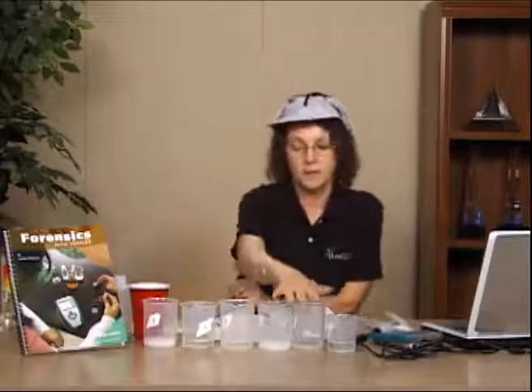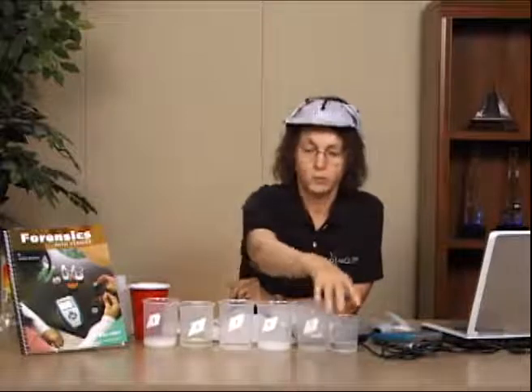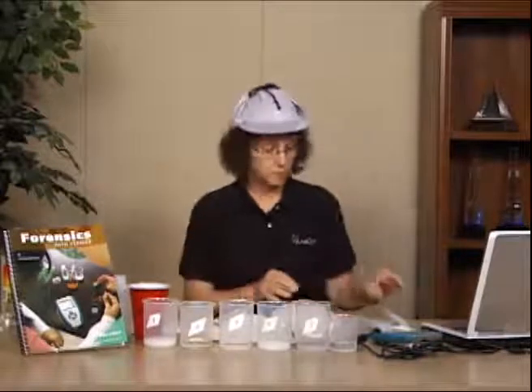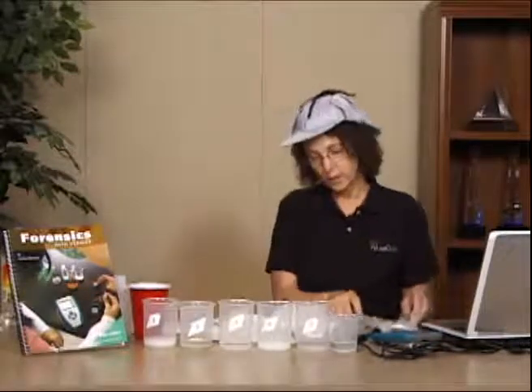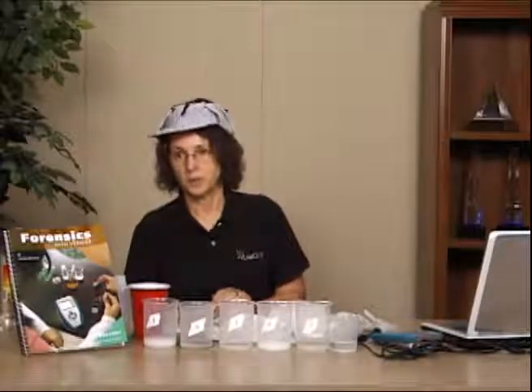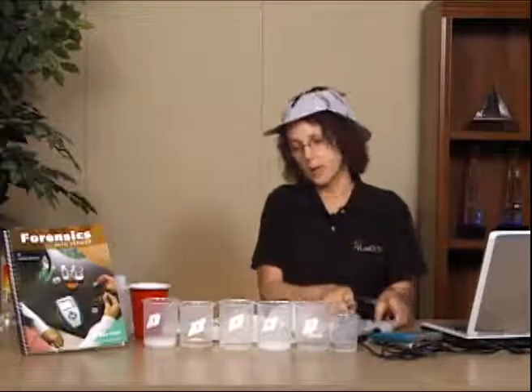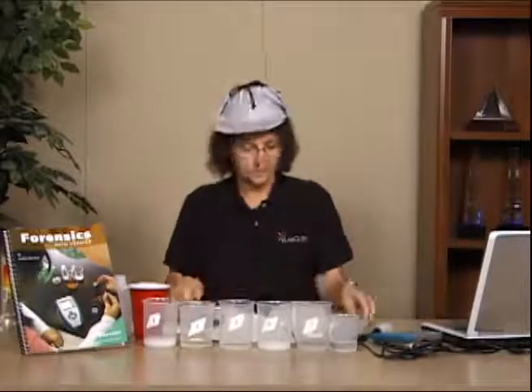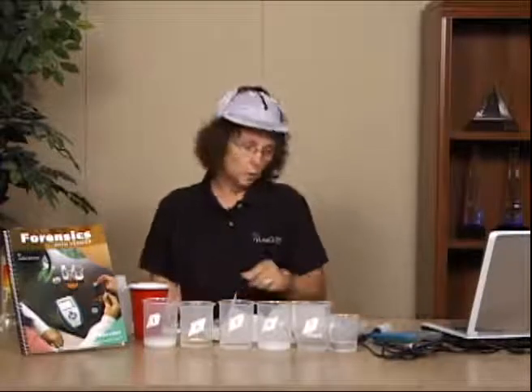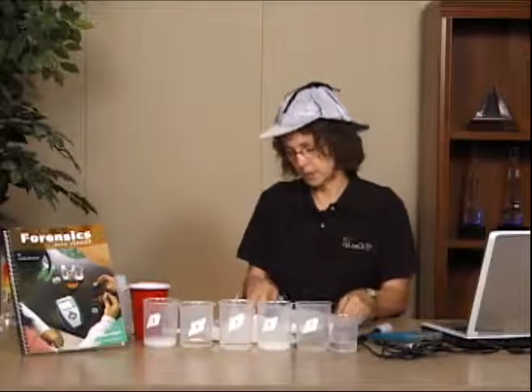If all of these samples started out with the same mass, then how much was left on the bottom would be significant. So you want to make sure that the students have actually weighed that out, or if you are in a situation where you have a short period of time, that you've weighed out those samples for the students yourself. Once this part of the lab is over and you have your 5 samples and you know their solubility in water, then you're going to go on to your actual testing with the science probes.